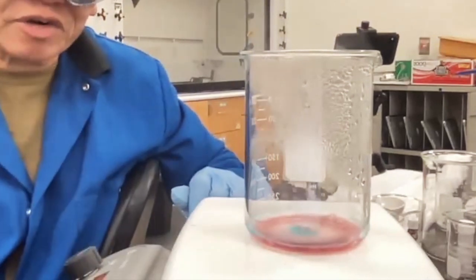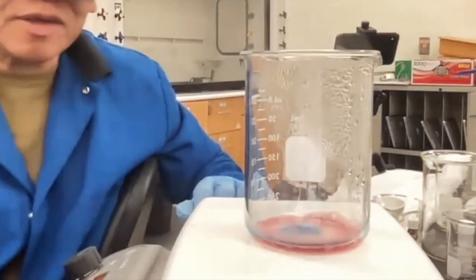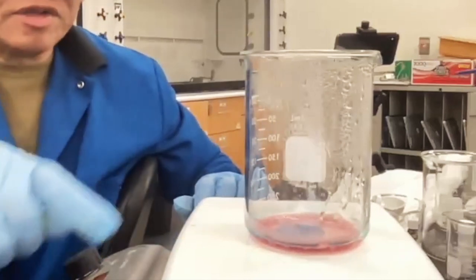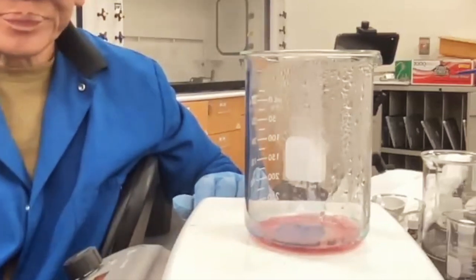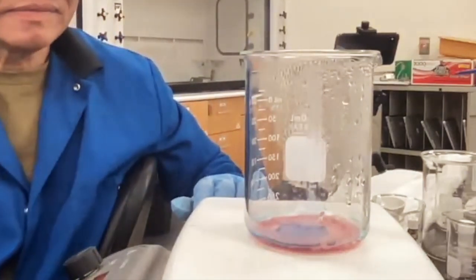See how the center's turning powder blue, like the chargers, the former chargers? Well, that's the color that you want to make that observation. Okay, so what I'm going to do is at this last bit, I'm just going to turn off the hot plate and allow the heat from the hot plate to evaporate the rest.